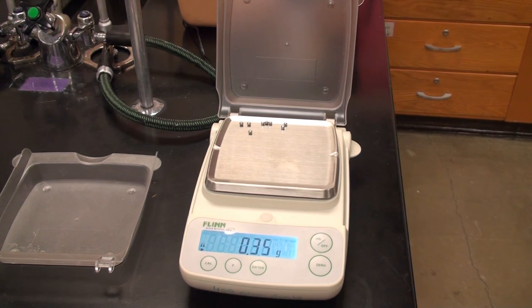So that's it for a little while. So your job right now, go ahead and get the masses written down and make sure we get the averages.